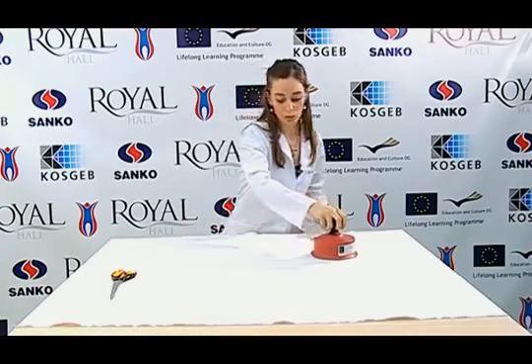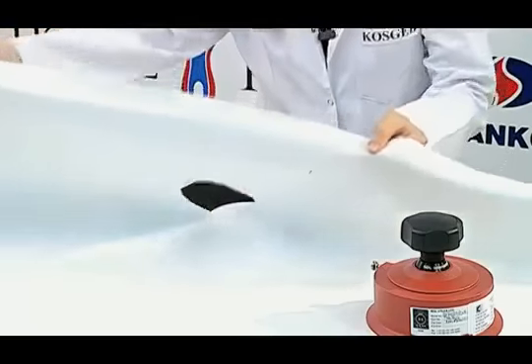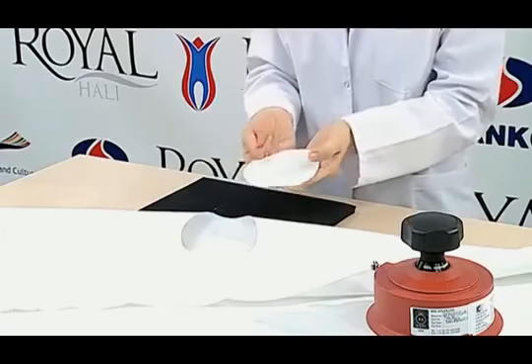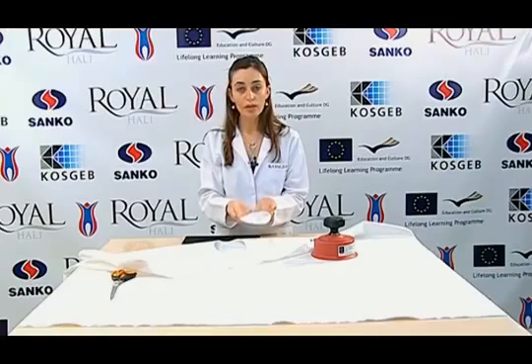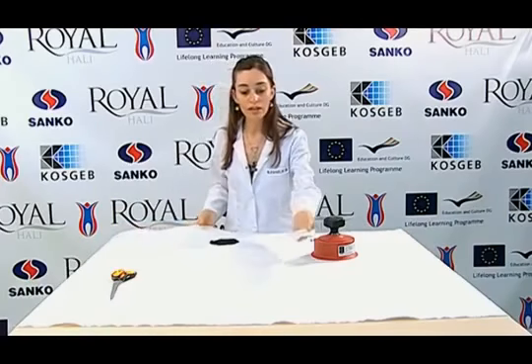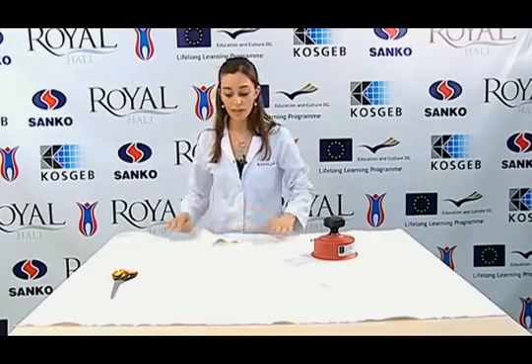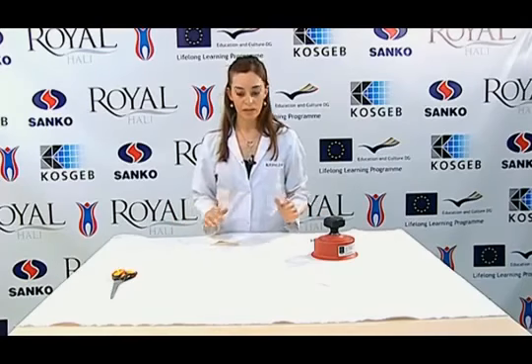We lift the sample holder. Then, I lift the sample without causing any yarn loss. This way, I complete the preparation of the sample of a 100 square centimeter circular area. I repeat the same task 4 more times to have a total of 5 samples. At this point, attention should be paid to take the samples from different parts so that the samples can represent the whole fabric.